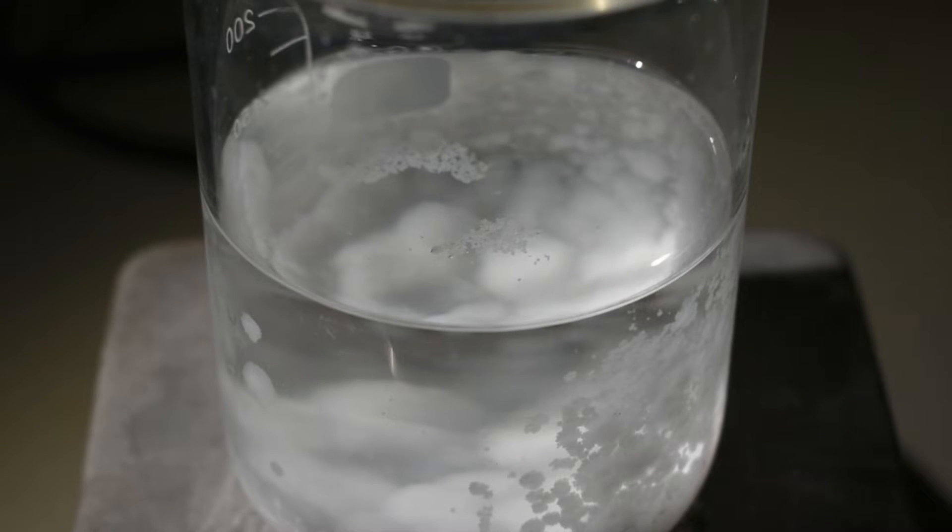Anyway, all I have to do now is take this out of the beaker, basically just decanting off the liquid, and then filter the crystals and dry them.